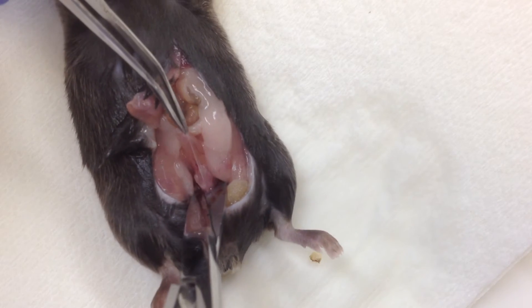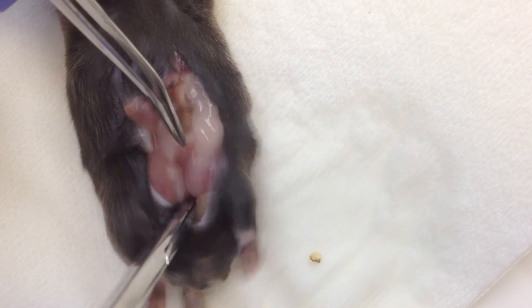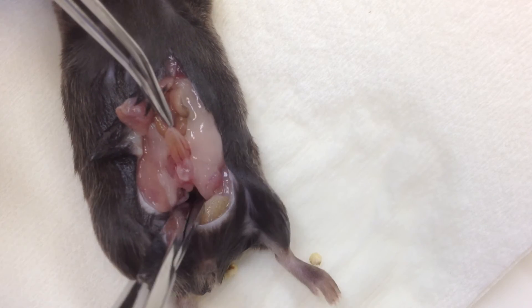When you do that, what you should observe — holding the bladder — cut, and that should cause a click sound.